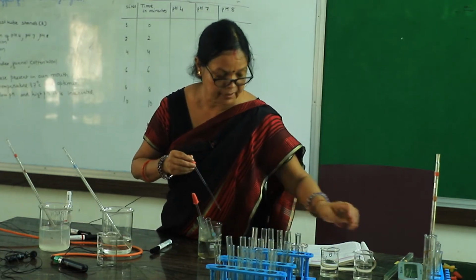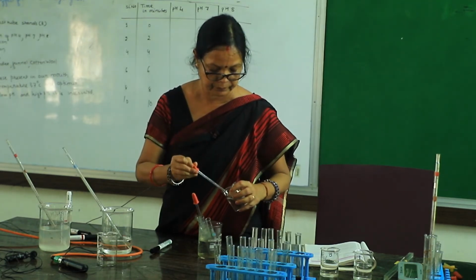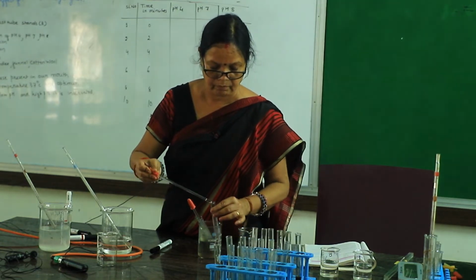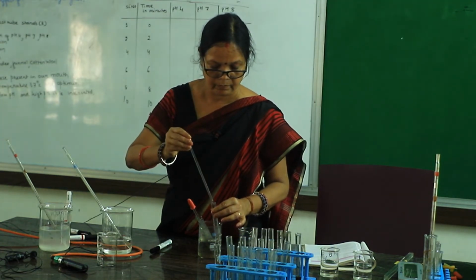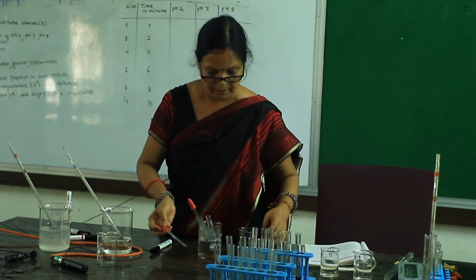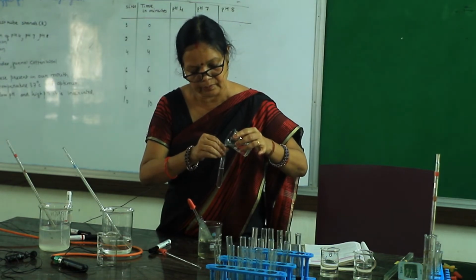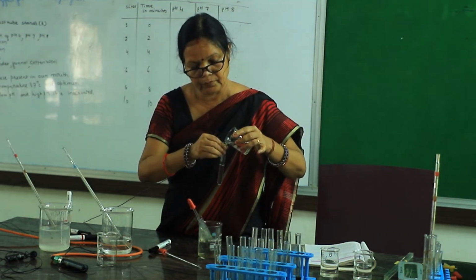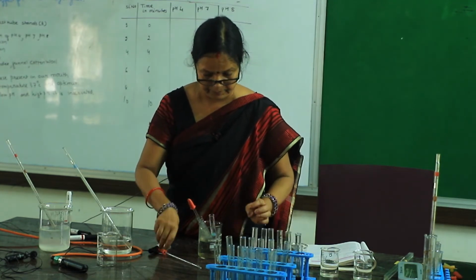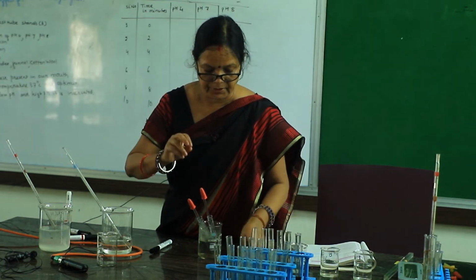This work is over. Then pH 8. Up to 1 milliliter you have to add, and keep this dropper in this test tube.